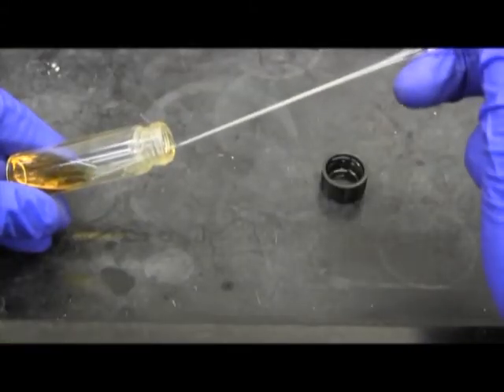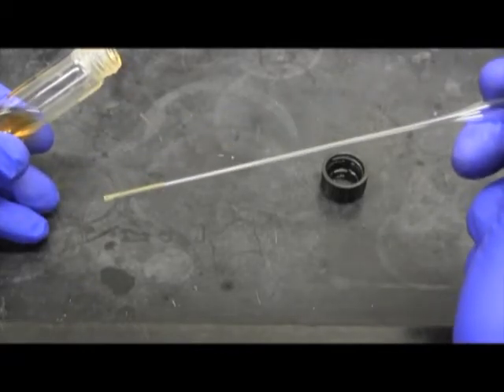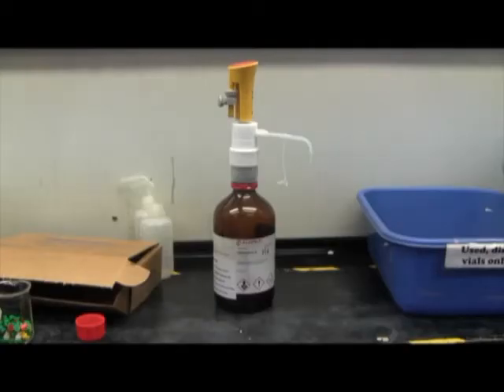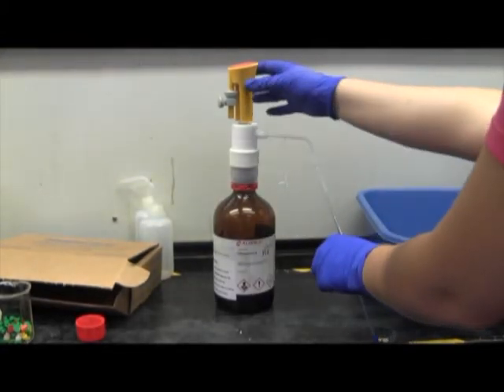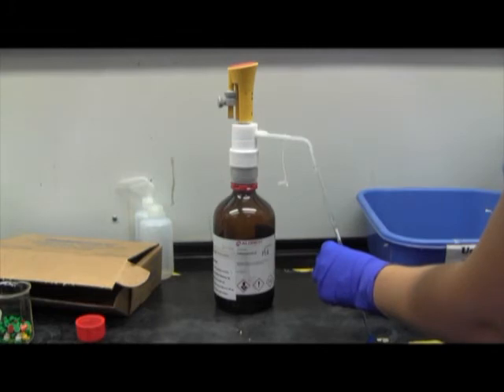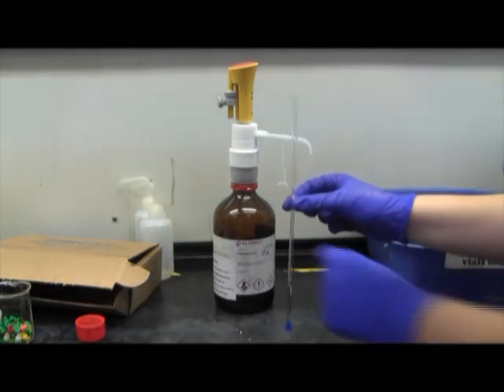Plunge the tip of the glass pipette into your liquid sample, and capillary action will pull up enough sample for an NMR. Then slide the glass pipette into the NMR tube and place it under the chloroform dispenser. Lift the top of the dispenser all of the way and let it drop on its own. This will add the correct amount of solvent to the tube.